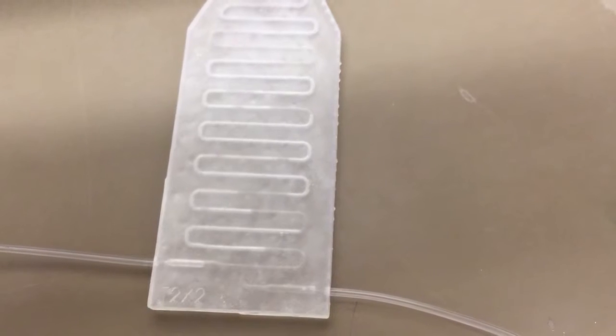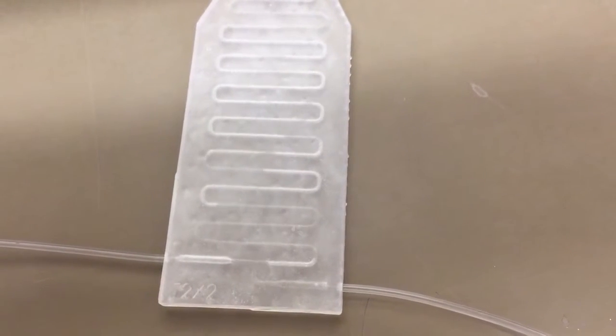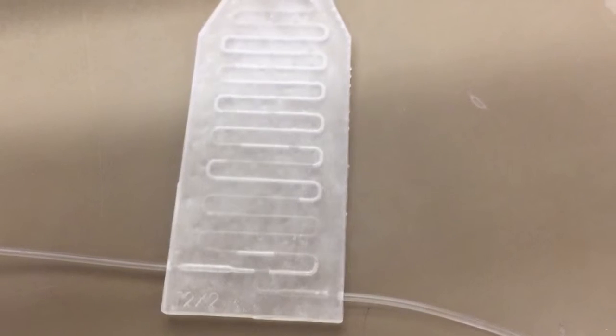Air, oops, too much air. Too much drop, too much air. Okay, little drop. Which one is the air? The air is the white one. The clear one?